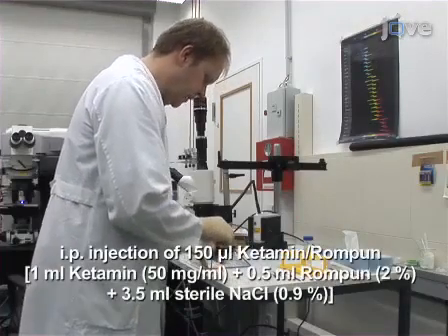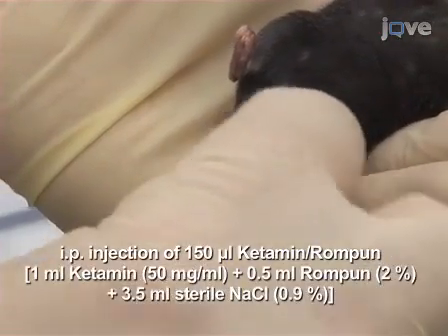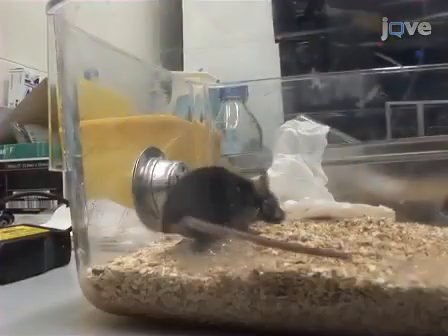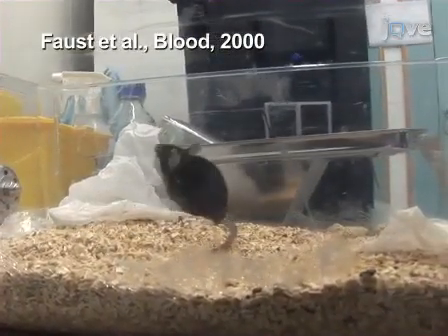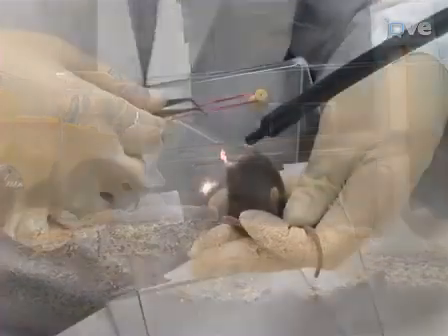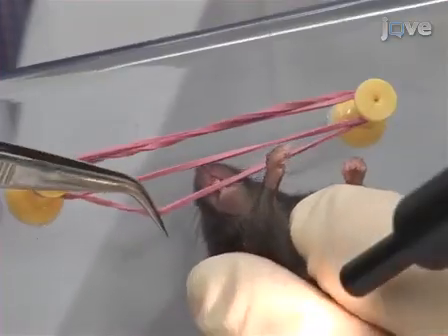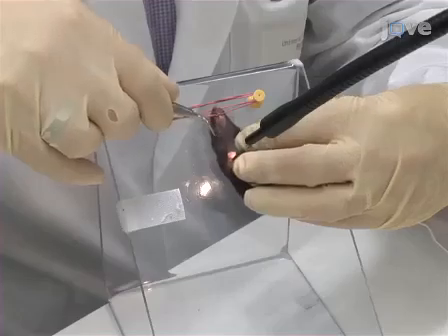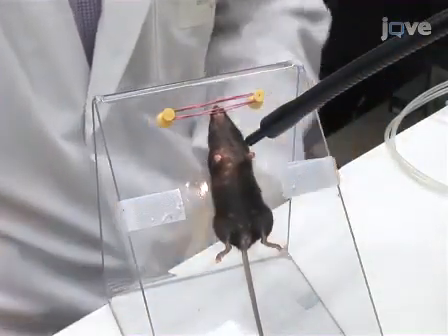To prepare the mouse for infection with the spore solution, the animal is anesthetized and sedation is confirmed by lack of response to toe pinch. In this video, LysEGFP mice, which carry EGFP under the lysozyme promoter and therefore have EGFP-positive neutrophils, are used. 5 minutes after administration of anesthesia and confirmation of sedation, use an elastic band to suspend the narcotized mouse on a bevel by its teeth.